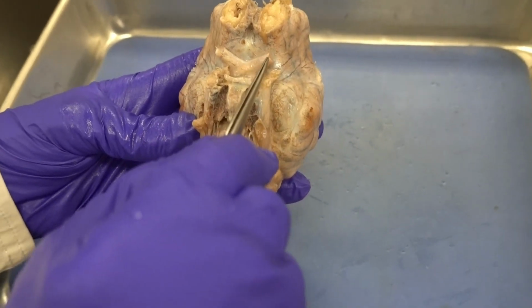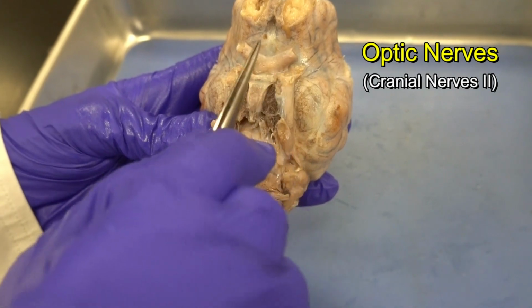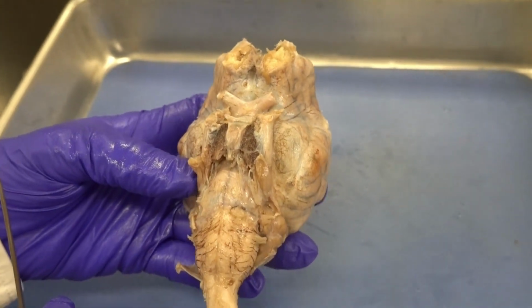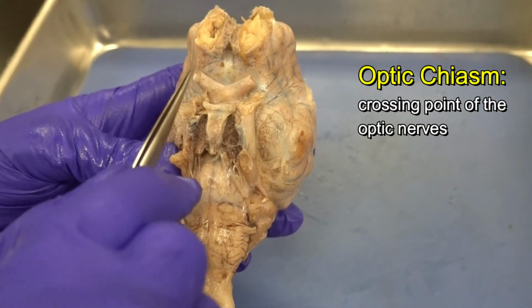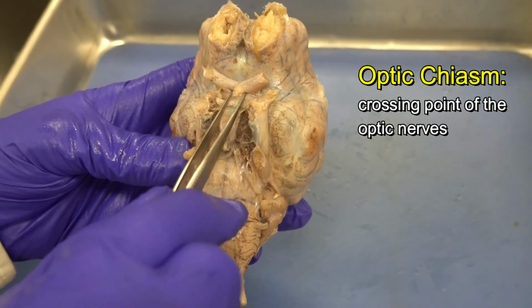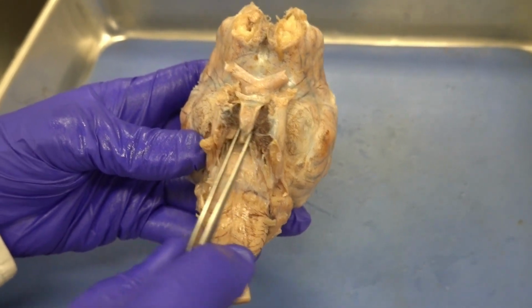The structures that we see here, these two, are the optic nerves. Please recall, optic nerves are cranial nerve number 2, but olfactory nerves are cranial nerve number 1. And exactly in this place, some of the axons of each optic nerve cross and go to the opposite side. We call this part the optic chiasm.